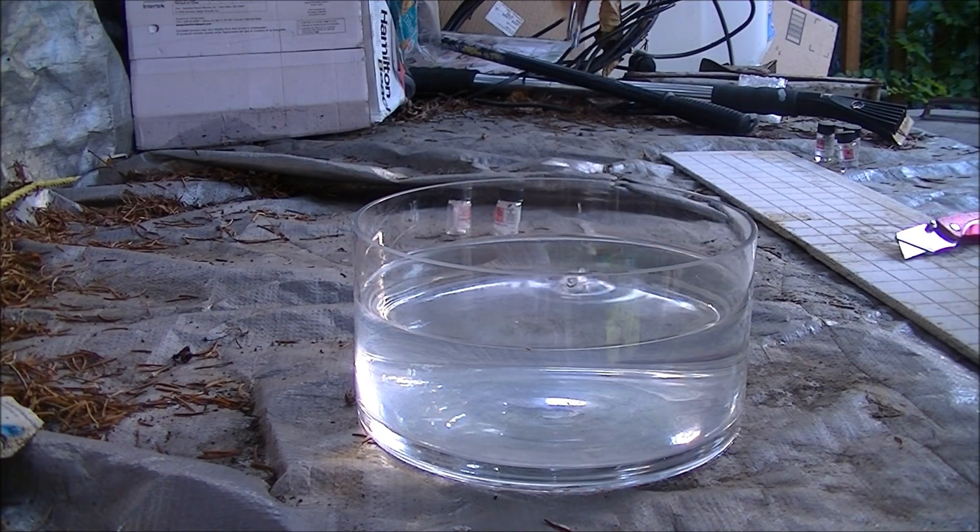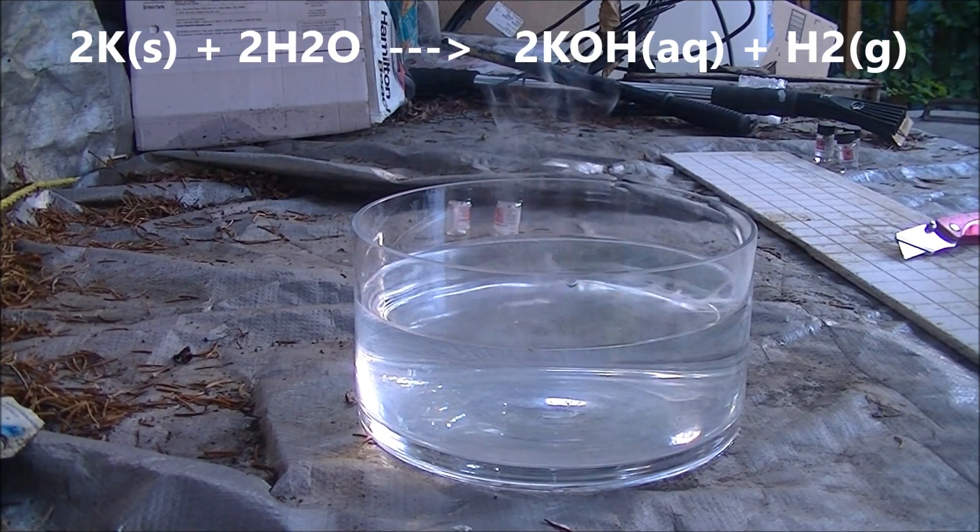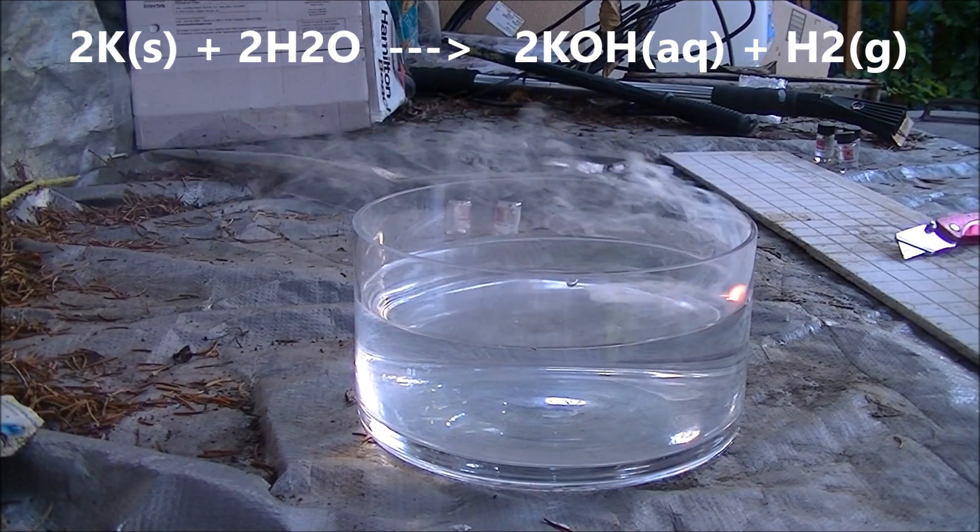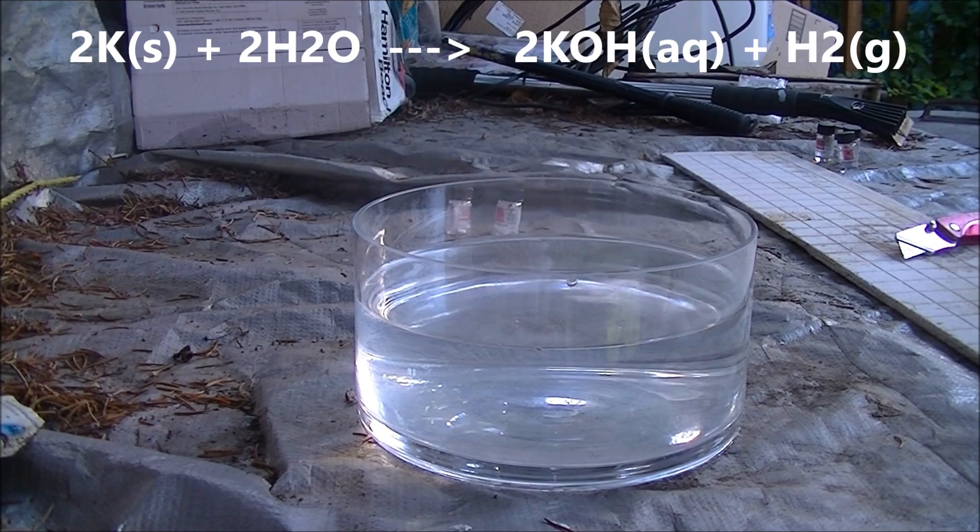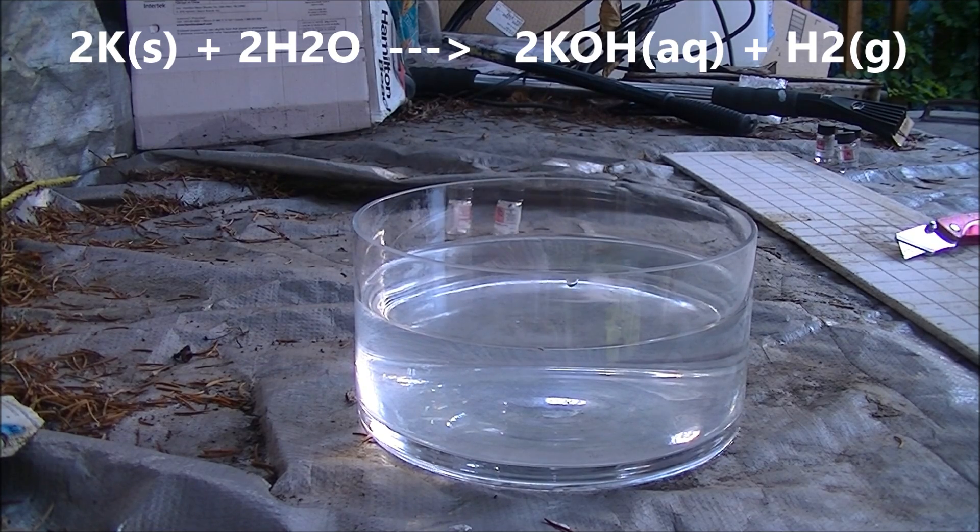Next up is potassium. The reaction is actually quite intense now.